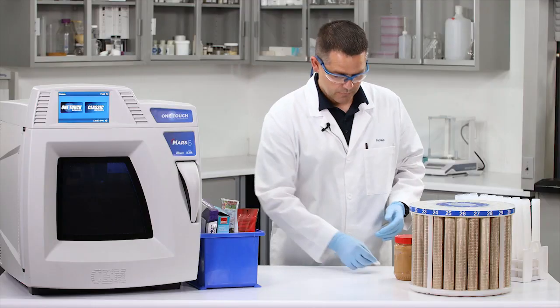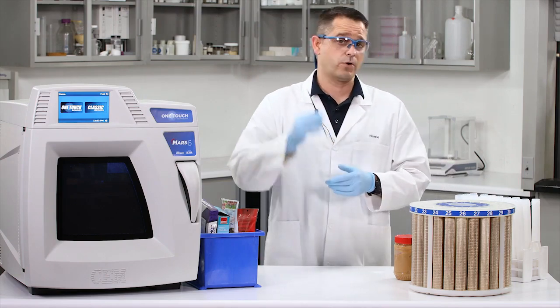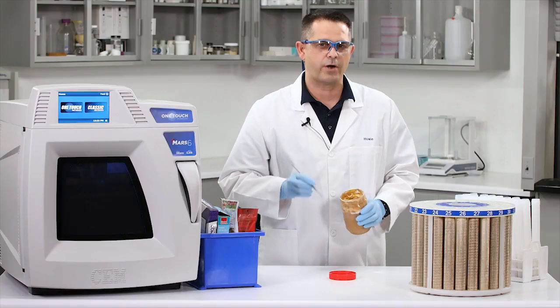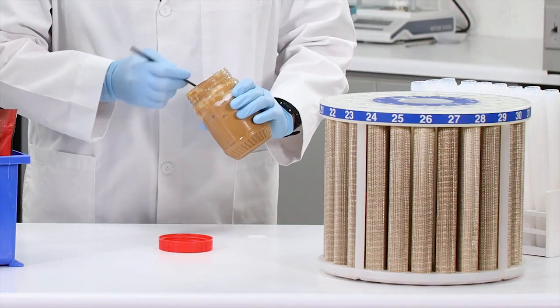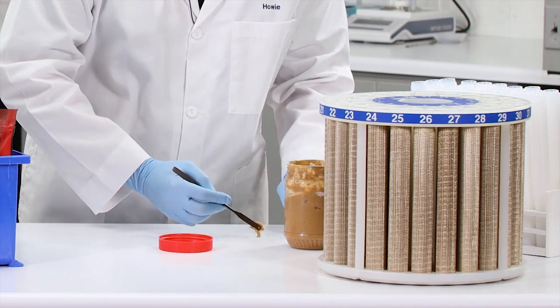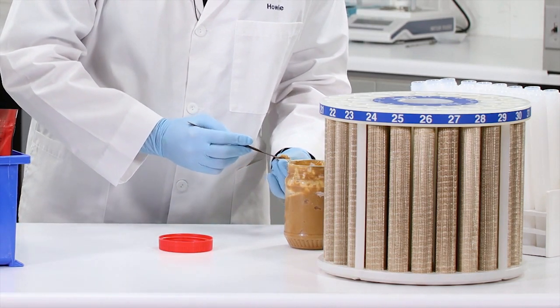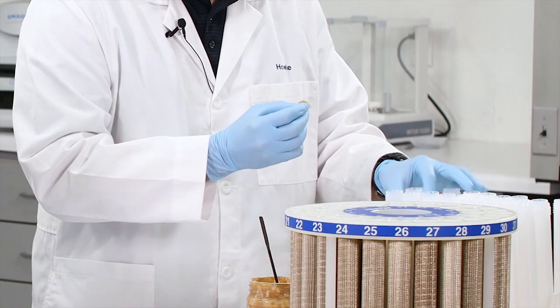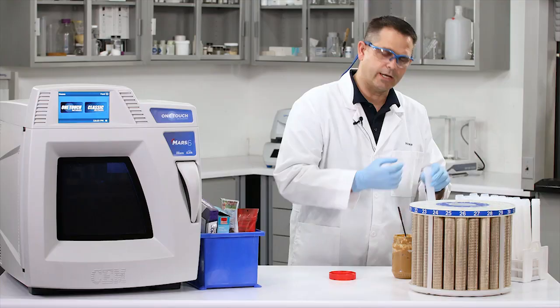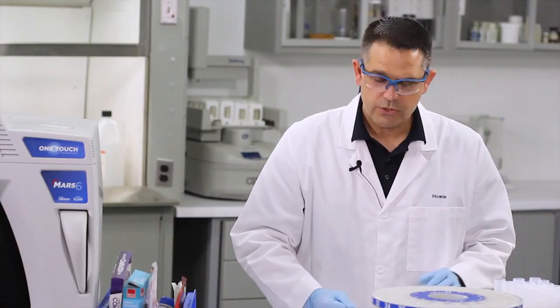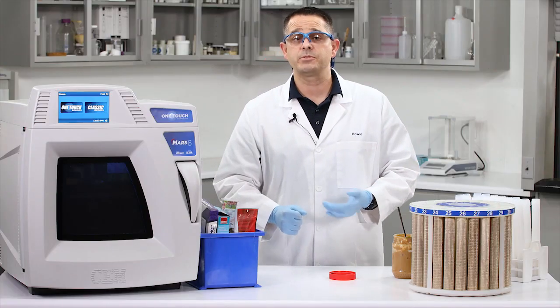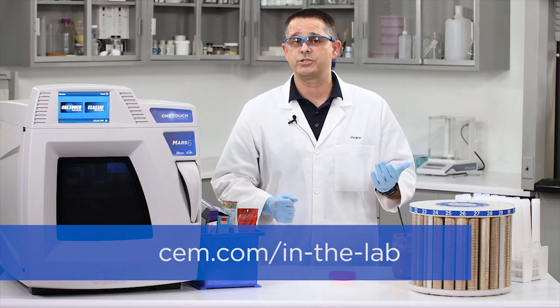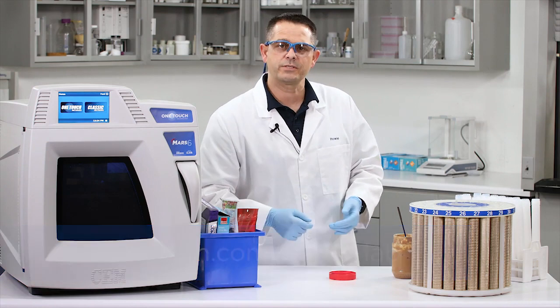I will use my non-metallic, or in this case a Teflon-coated spatula. With my calibrated eye, I'm going to get about a half a gram of peanut butter, fold it a little bit, and then we're going to slide it all the way down to the bottom. For other tricks for other sample types, please visit our website and our In the Lab section for additional information. While you're doing that, let me get the rest of these samples ready.